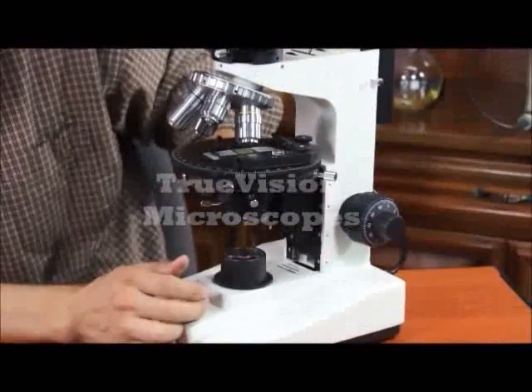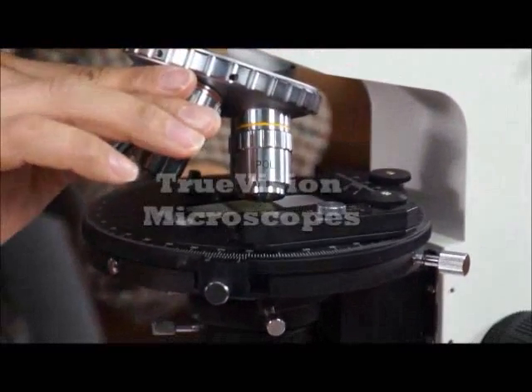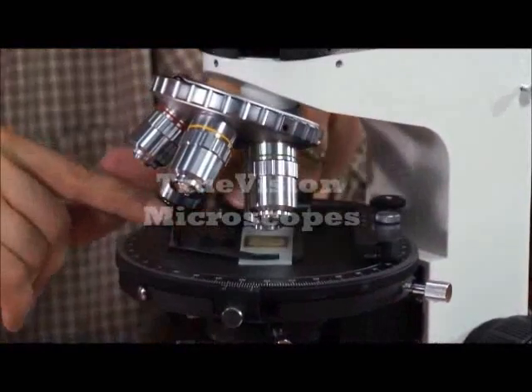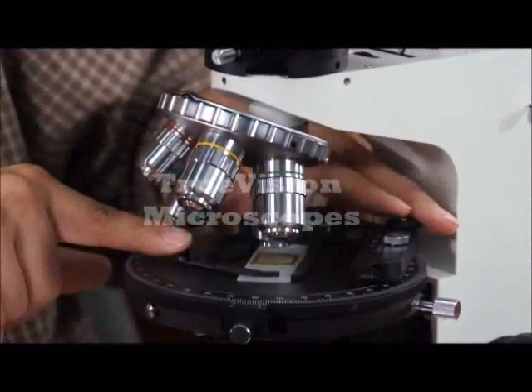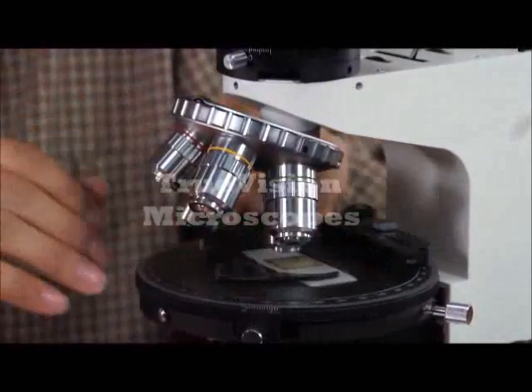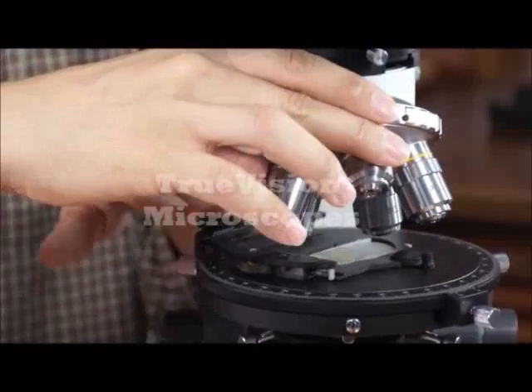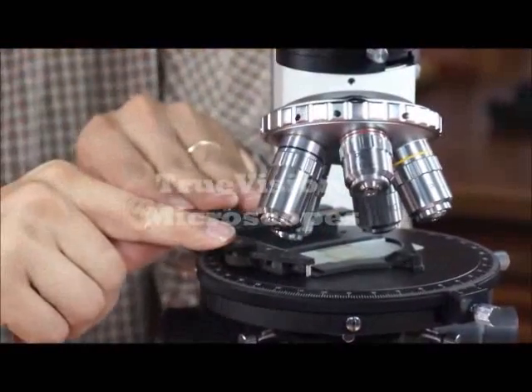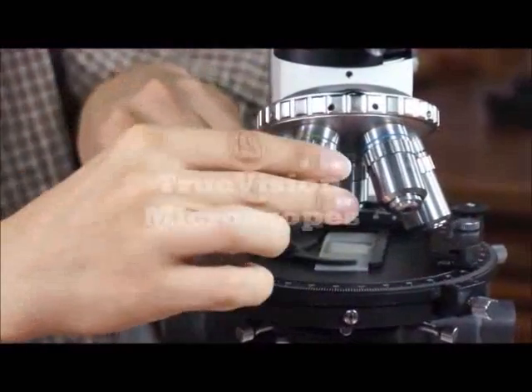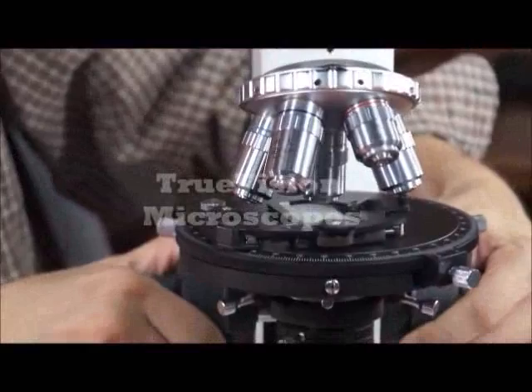One thing to note is when you're looking at a specimen and you want to change the magnification power, sometimes you have to lower the stage — it may hit. If this XY slide holder were not there, it would not be a problem. It depends on the orientation of the slide holder, and on how close you are to the specimen.